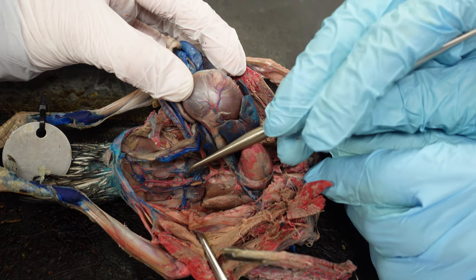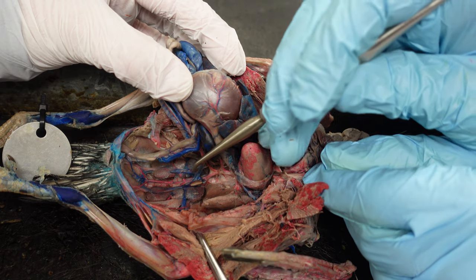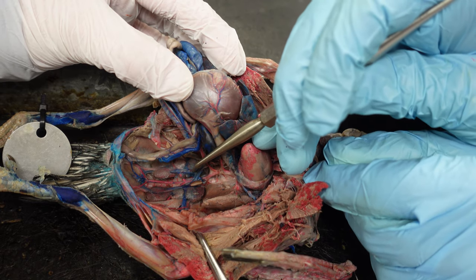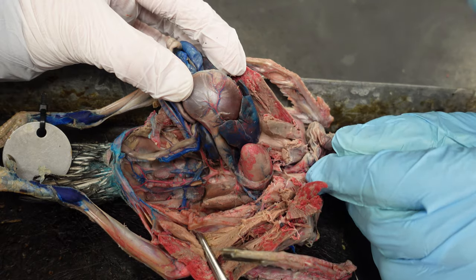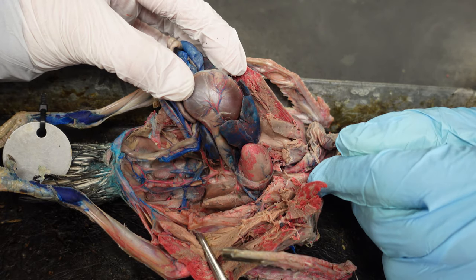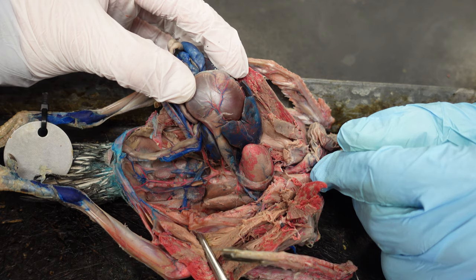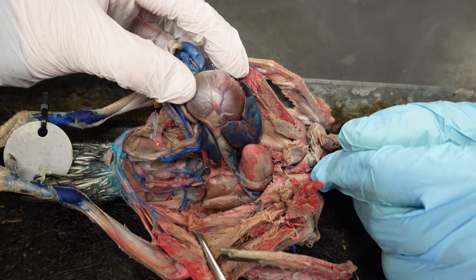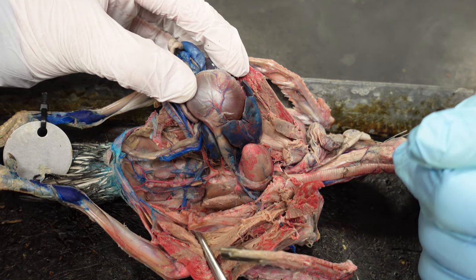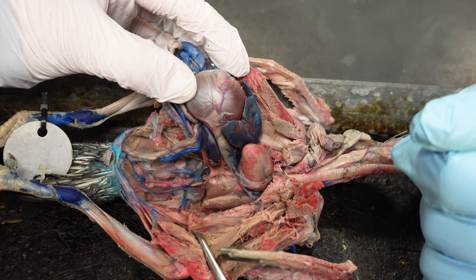In the female, they'll have a large ovary — it looks like a cluster of grapes. And then there's a very large oviduct that heads out to the cloaca. And sometimes you'll find eggs within that that were ready to be laid.